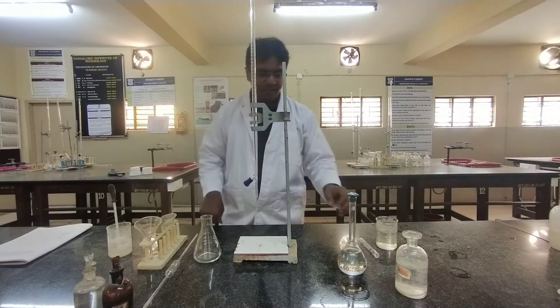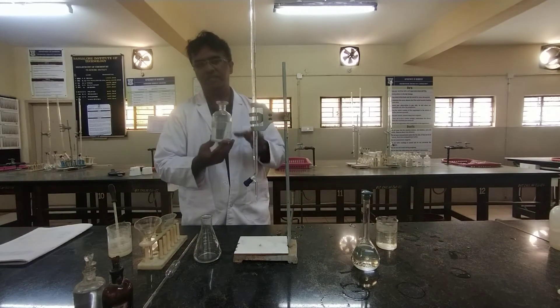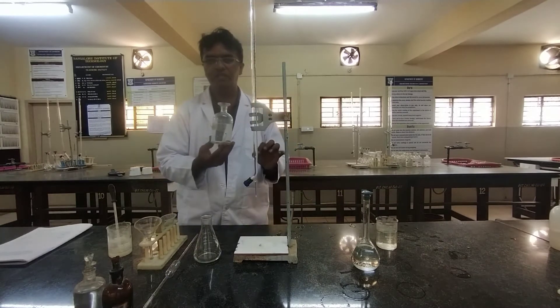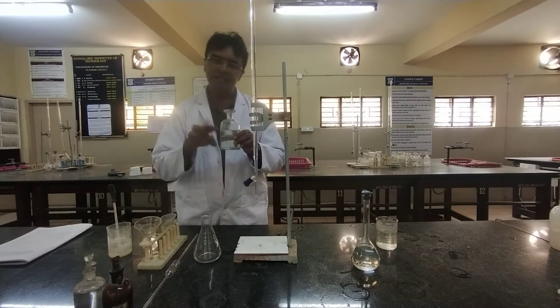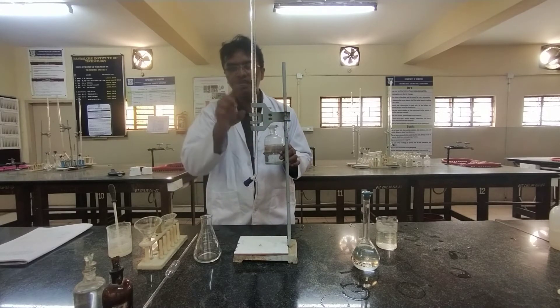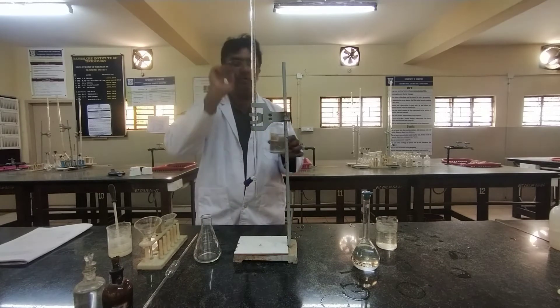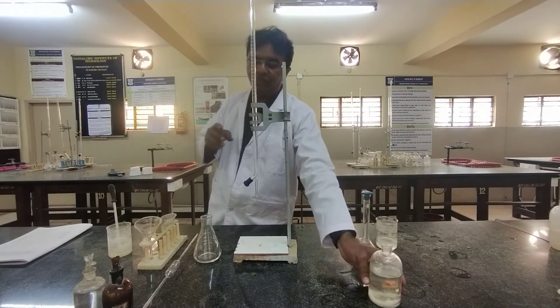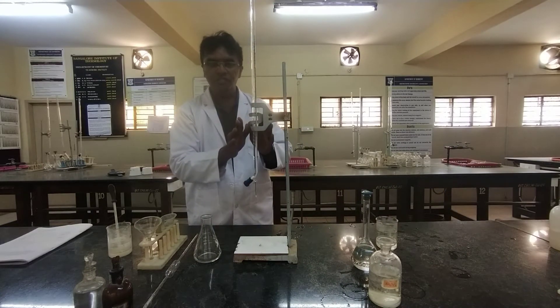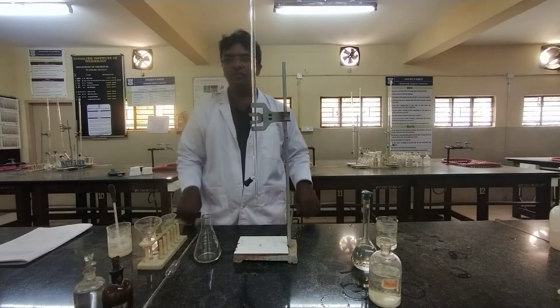In this experiment you will be given a standard solution of sodium thiosulphate with a normality of 0.01 — we prepare this standard solution ourselves. You wash the burette with water, then rinse the burette with the sodium thiosulphate solution and fill the burette with it.